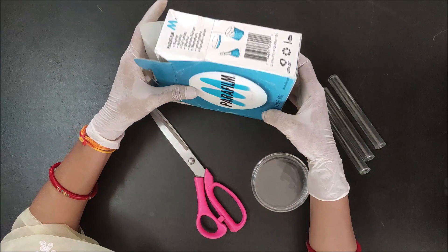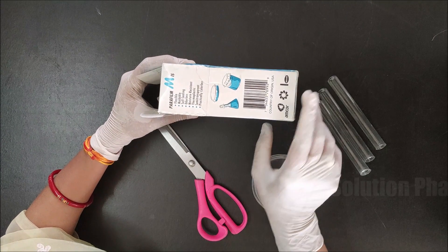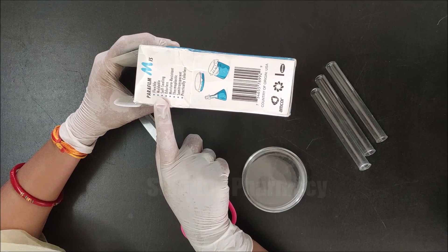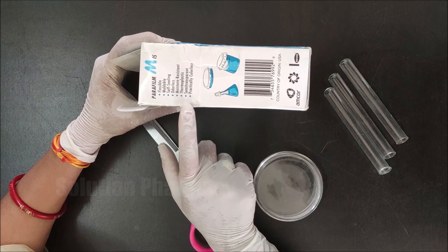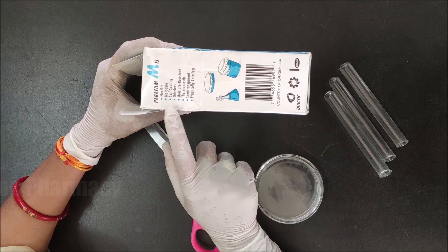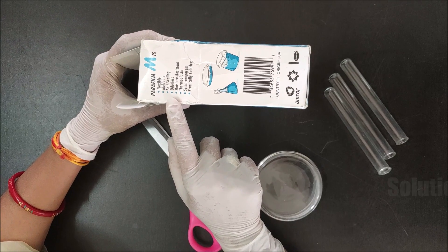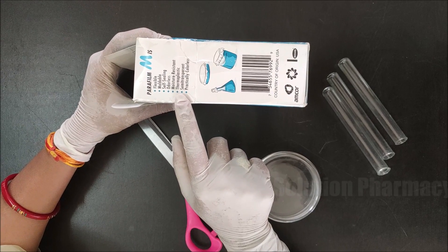The properties of parafilm are written on the box. Parafilm is flexible in nature and very stretchable. We can stretch it because it is made up of a plastic type material — parafilm is a blend of wax and polyolefins, which is a type of thermoplastic. Parafilm is moldable, meaning we can easily mold it into any shape.